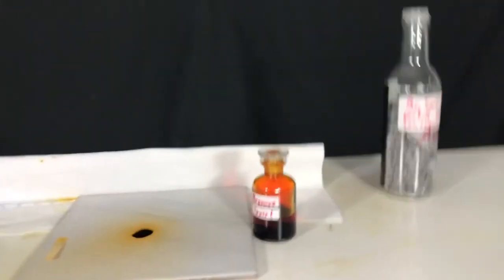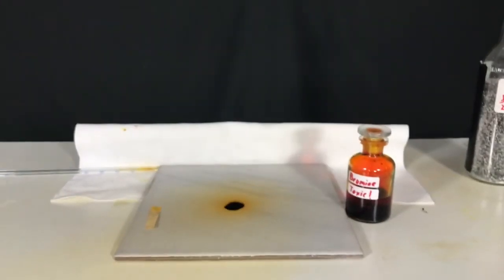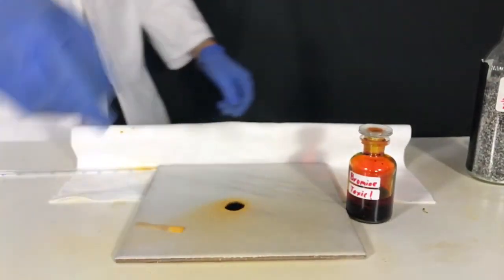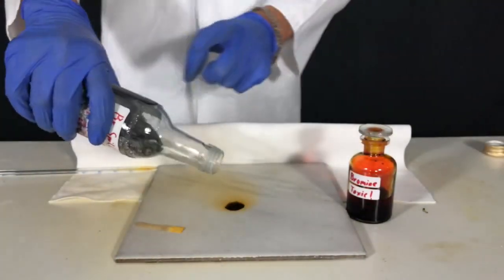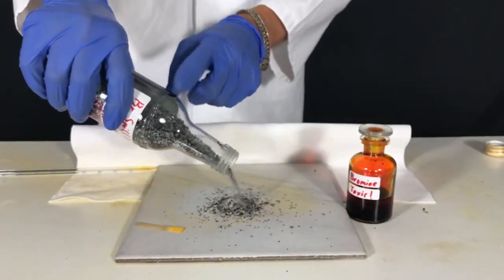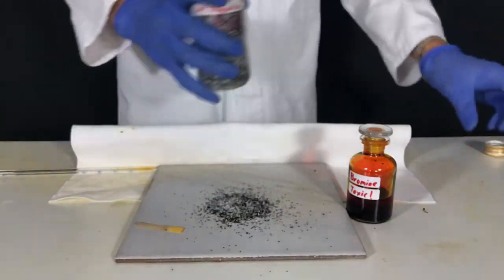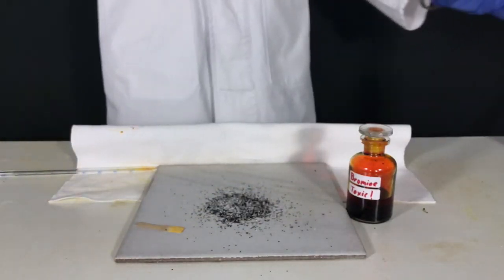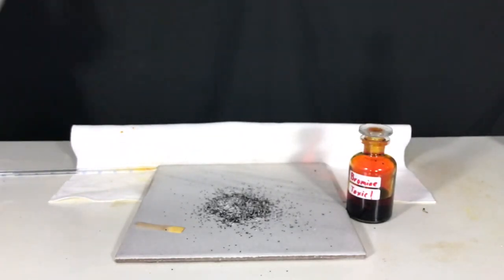The vapors stay down on the tile because bromine vapors are really heavy and they don't disperse into the air very well. Now, some of the spill kit powder is added to the bromine. You can immediately see the vapors being sucked up. Also, no more vapors are escaping from the bromine spill.